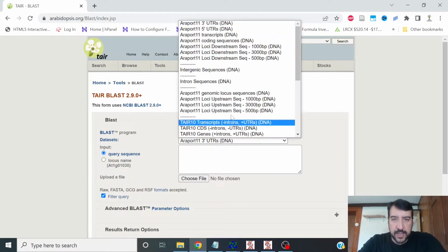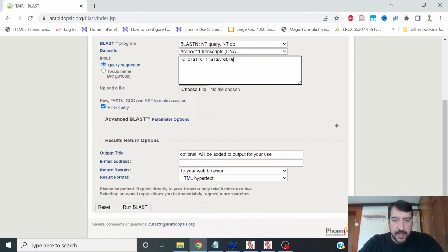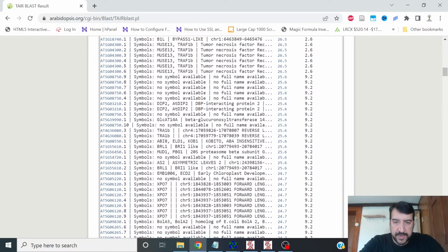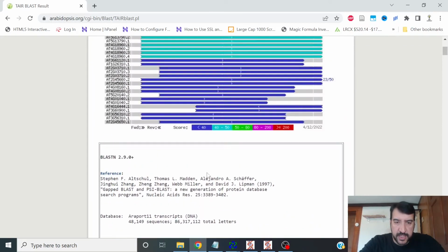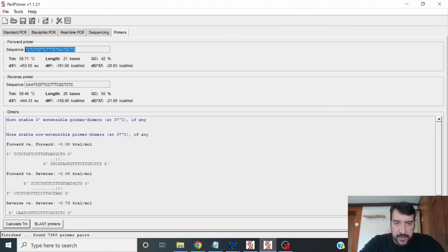I'm going to put this on transcripts. I'm going to paste in this primer, and I'm going to run blast. Now you can see the blast results here. And you see that we have a perfect match to the gene that I started with, AGL15. That's fine. But unfortunately, we actually have a perfect match for some other things on another chromosome. And so this may not be the best primer to pick. Go back to PerlPrimer and pick the second one on the list here.